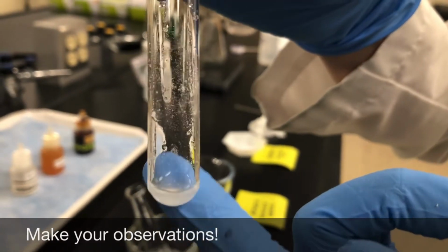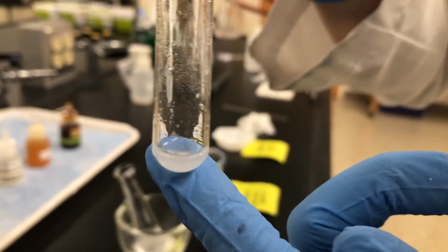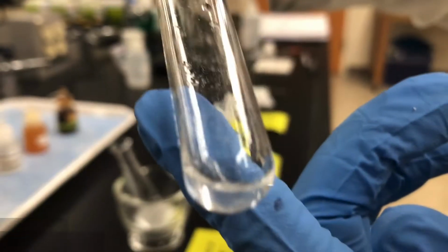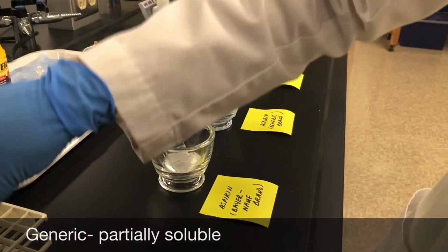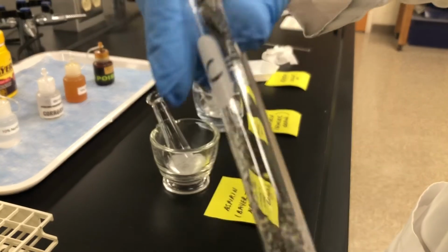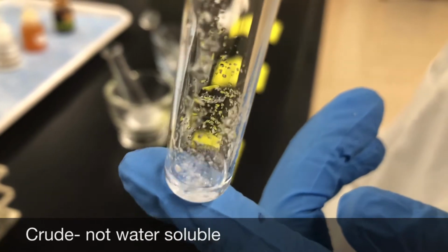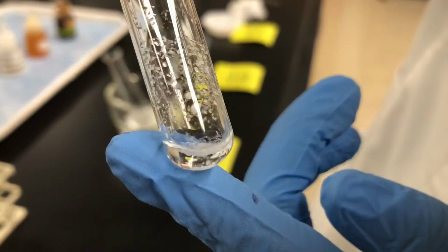You can see that the solution is cloudy, and there are some undissolved crystals on the bottom, so Bayer aspirin is only partially soluble in water. All right, and lastly, my crude aspirin, and that one didn't dissolve very much. So this one's not very water soluble at all.